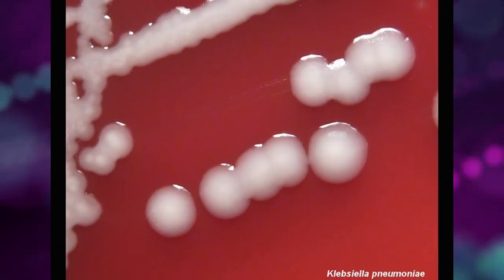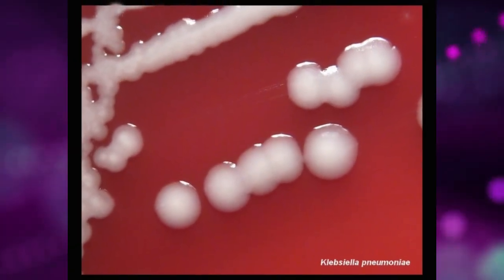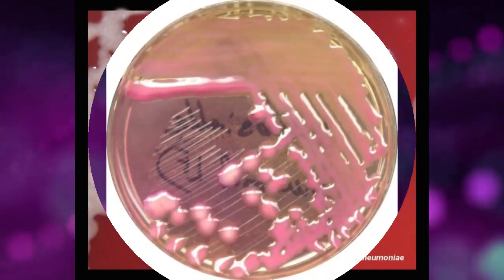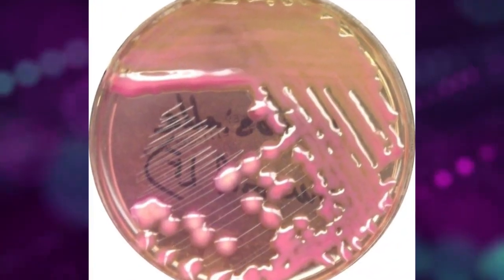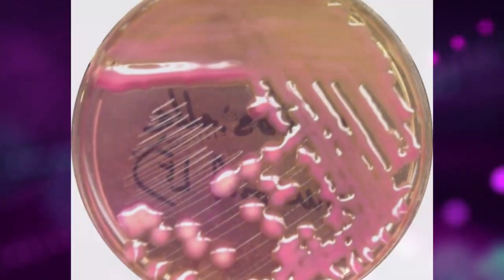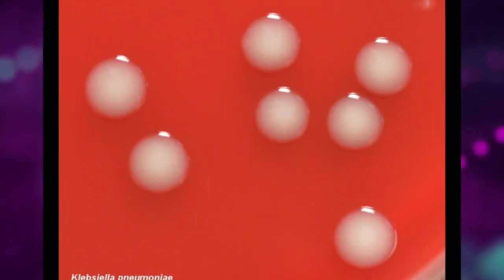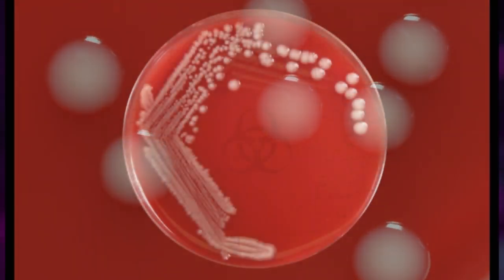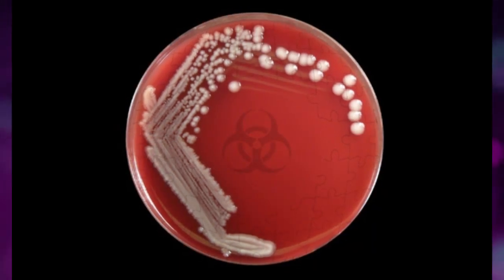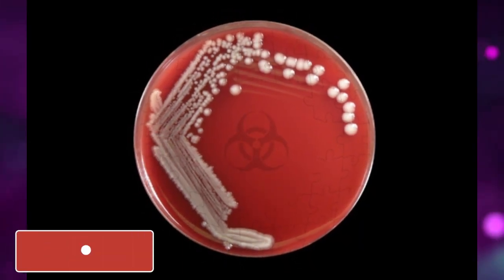The presence of a capsule gives colonies their typical glistening appearance and mucoid consistency. The colonies of non-capsulate, non-slime-forming mutants resemble those of other non-capsulate coliform bacteria.